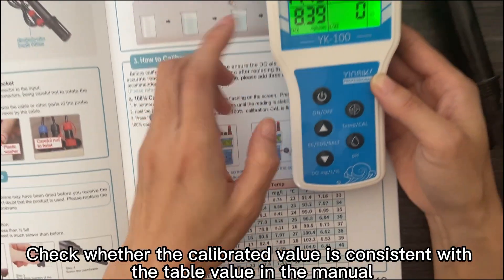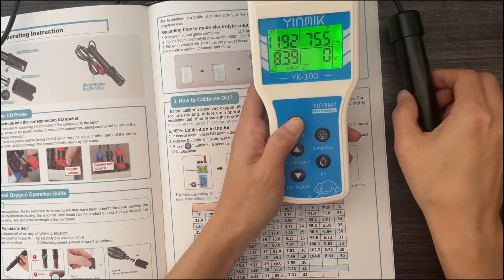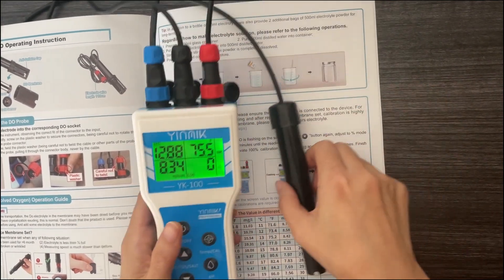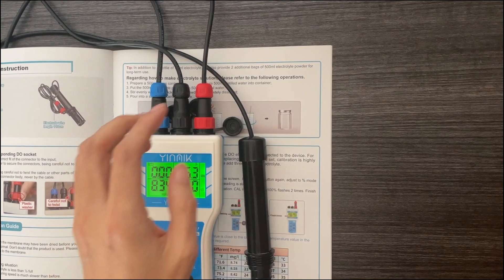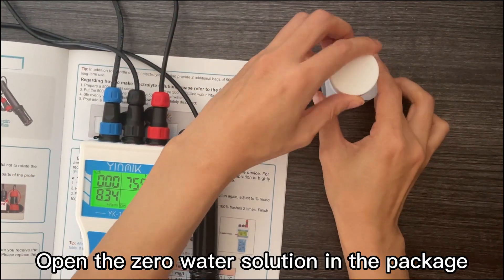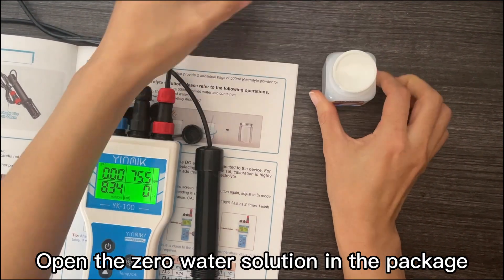Check whether the calibrated value is consistent with the table value in the manual. If the values are too different, multiple calibrations are required. Open the zero water solution in the package.